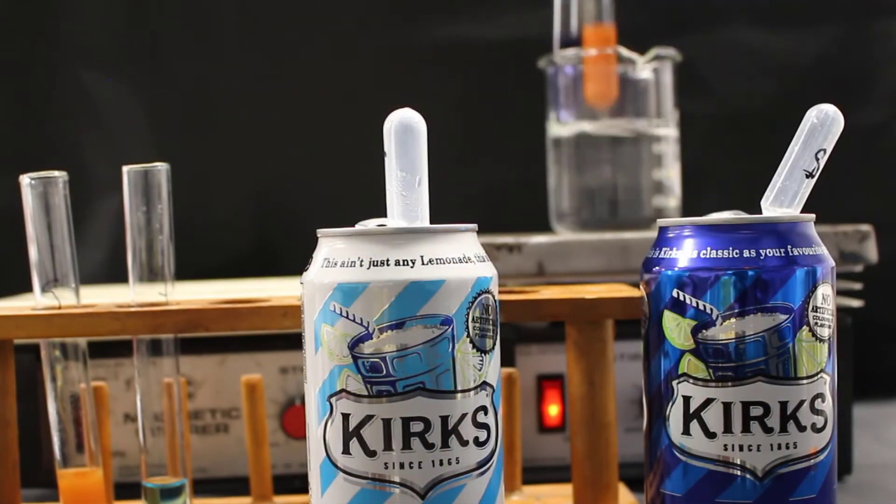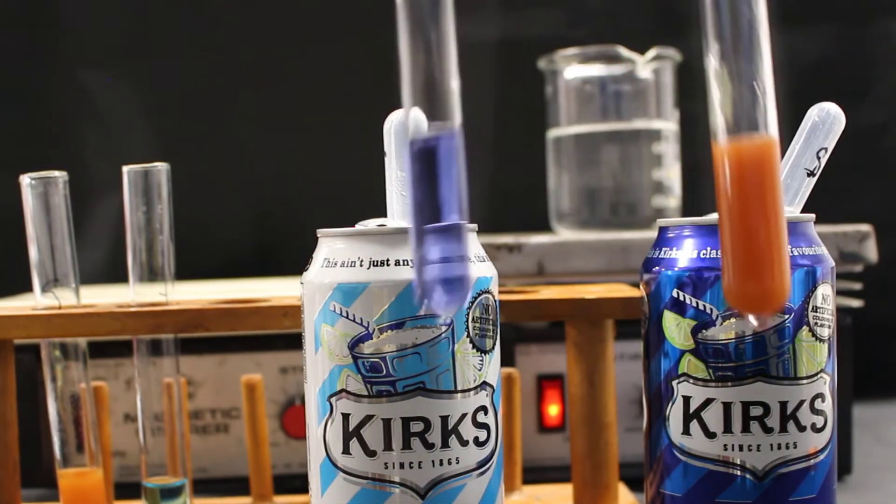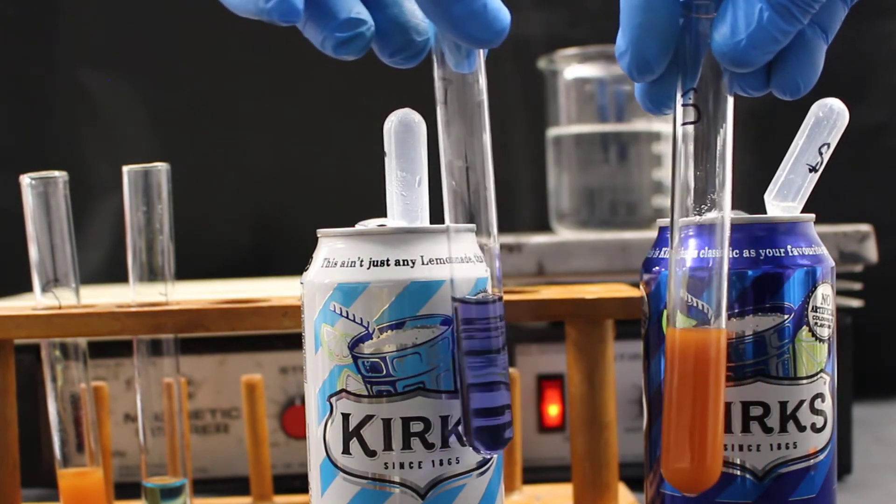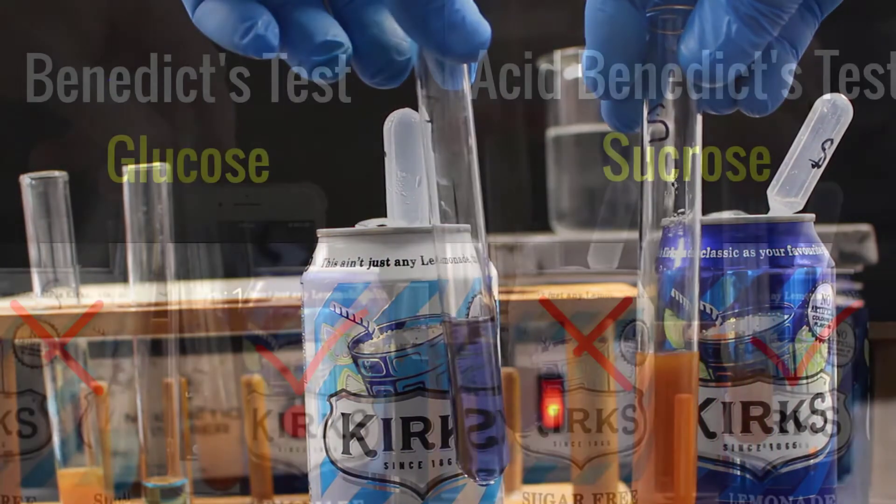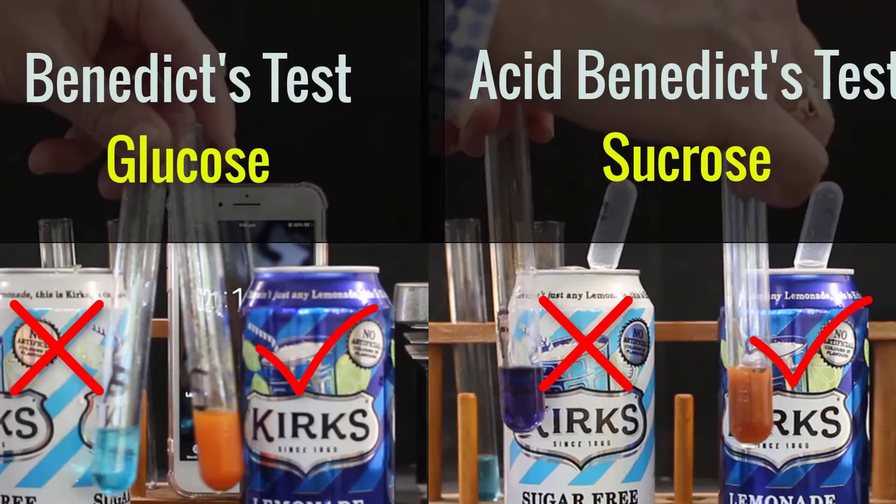So again, we've got a positive result for the lemonade that contains sugar. But we have a negative result for the sugar-free lemonade. So that means that the sugar-free lemonade does not contain sucrose or glucose. So that pretty well concludes that sugar-free lemonade does not contain sugar.